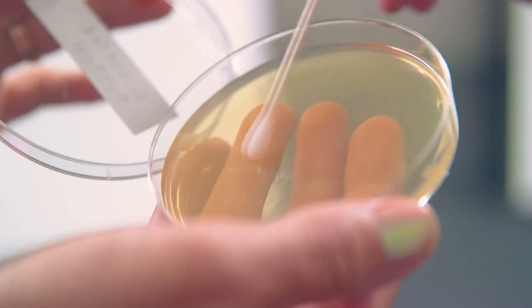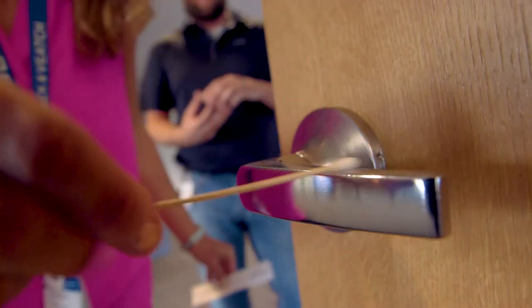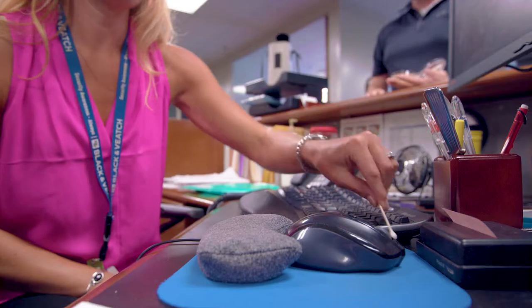Our two safety experts are getting samples from handrails along with other daily objects. Once these samples are collected, they will be put to the test to see how they compare to our handrails.